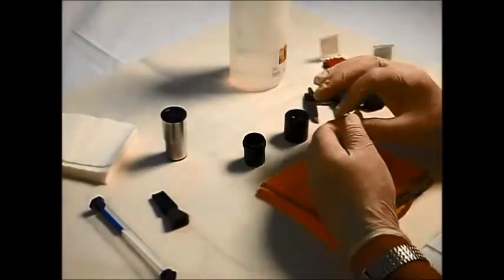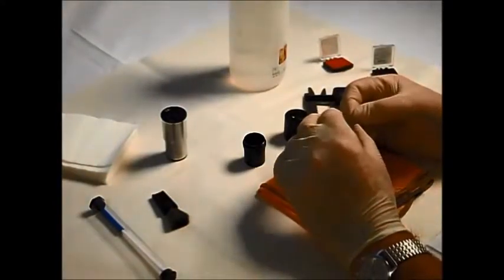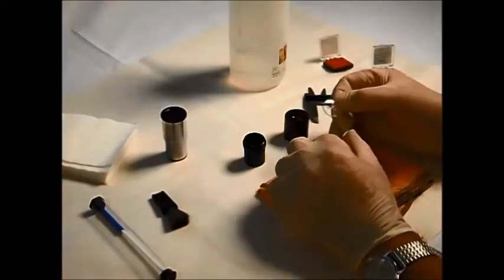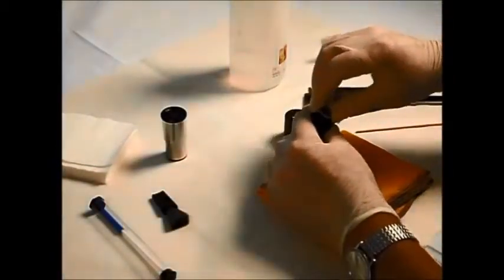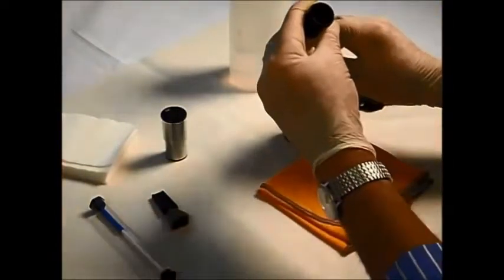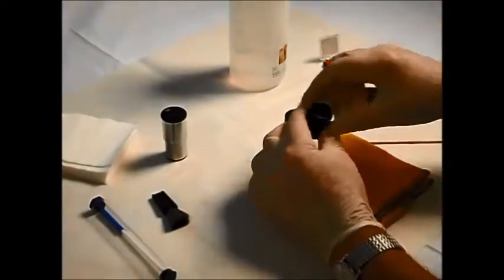Now a case of working out which side the chrome is on. This is a horizontal 10mm scale, and which side the chrome of the glass is on can be difficult to work out. A little bit of trial and error can help, but I can see it's actually on this side. So we need to put this looking down through the tube this way round. There we go. So that's fitted in there, seated in there.